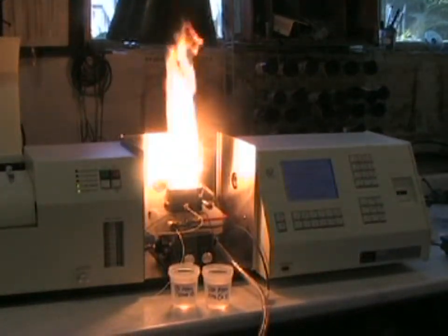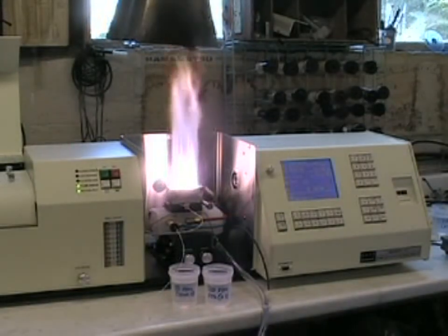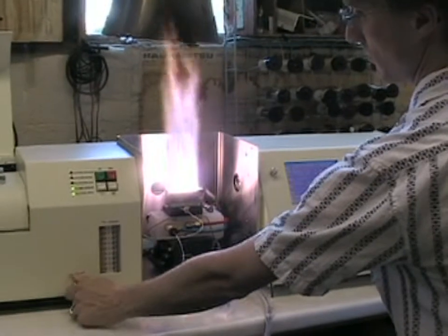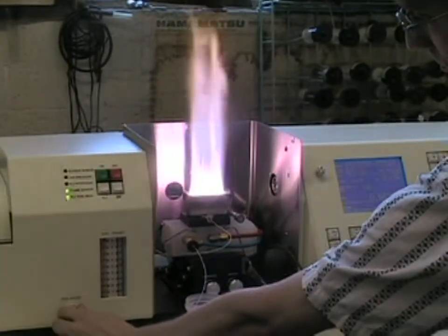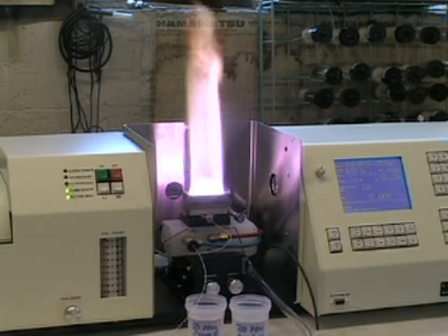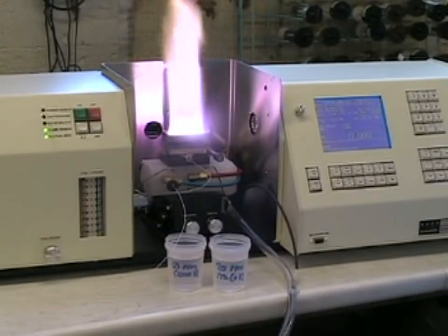This rich flame with the soot forming at the tip is normal, and then you have a very safe changeover to nitrous oxide. At this point we use the fuel adjustment knob to reduce the acetylene flow so that we have approximately a 1-inch red feather or red zone going over the burner head. We will fine-tune this with our sample and standards and by aspirating our blank.